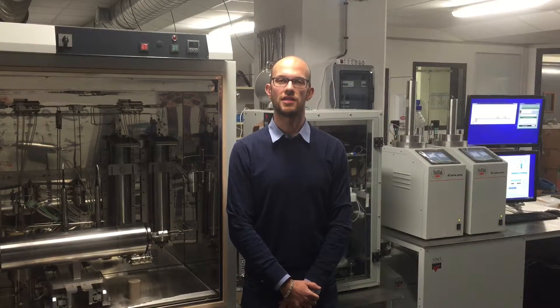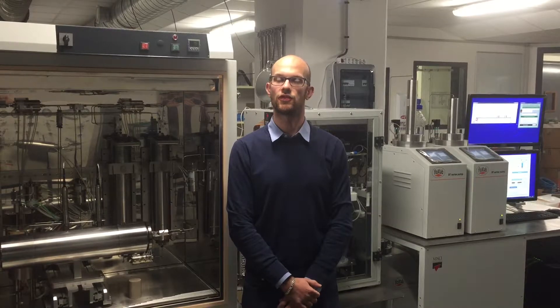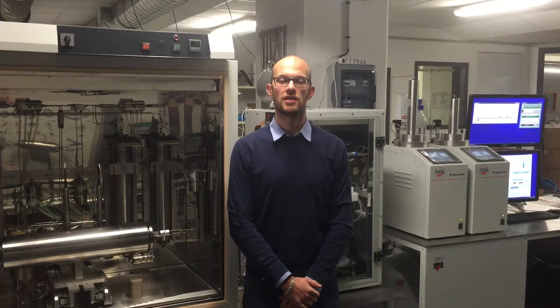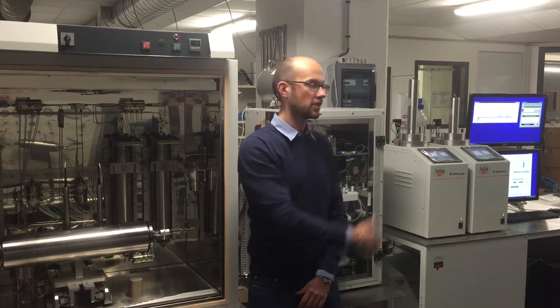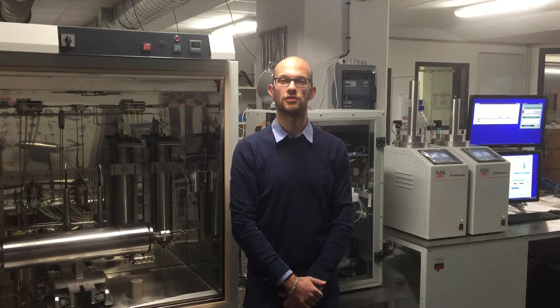This system is a laboratory scale system that's fully automated. The end user can use the software that's been designed by the Vinci team in order to do whatever he wants on the system.